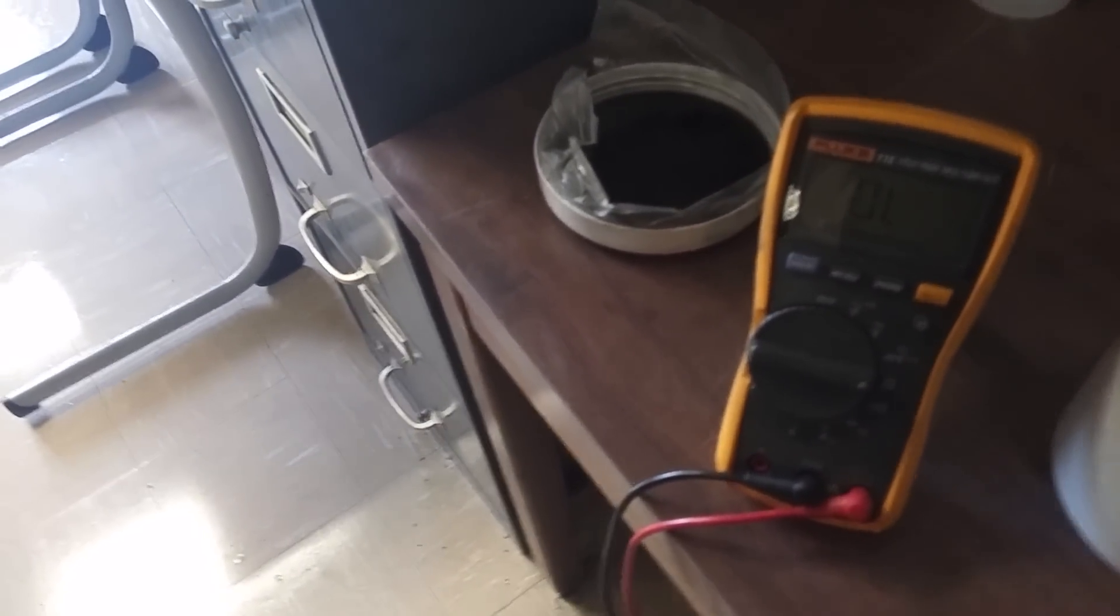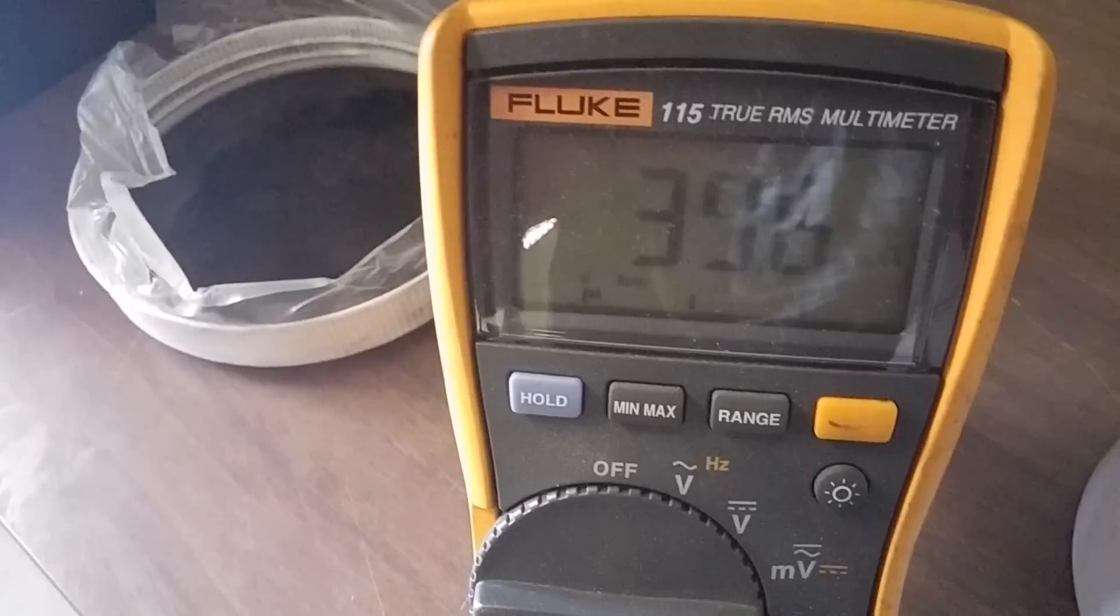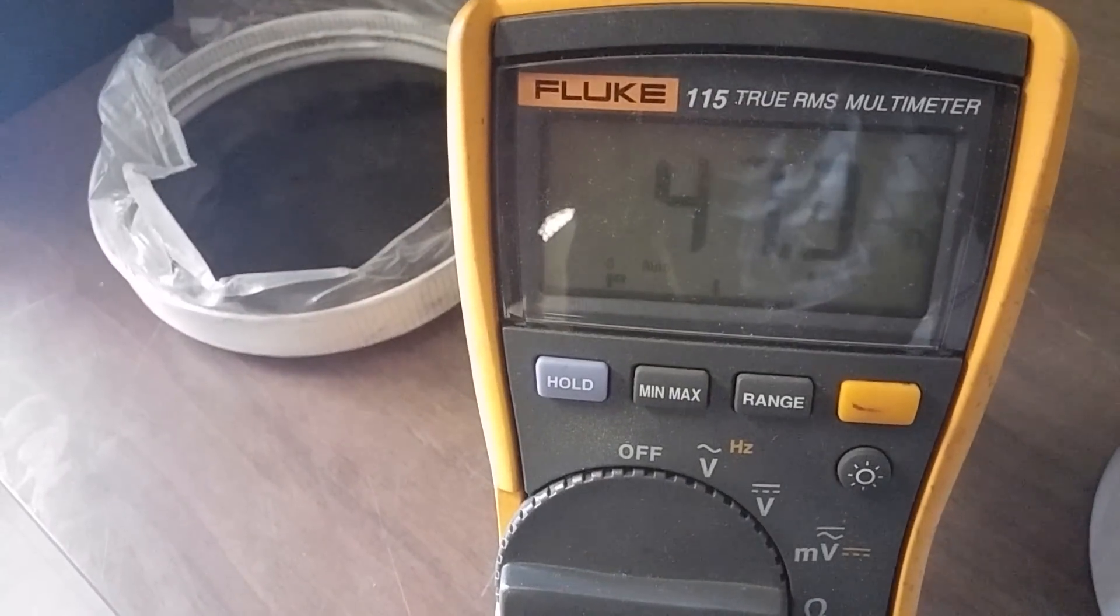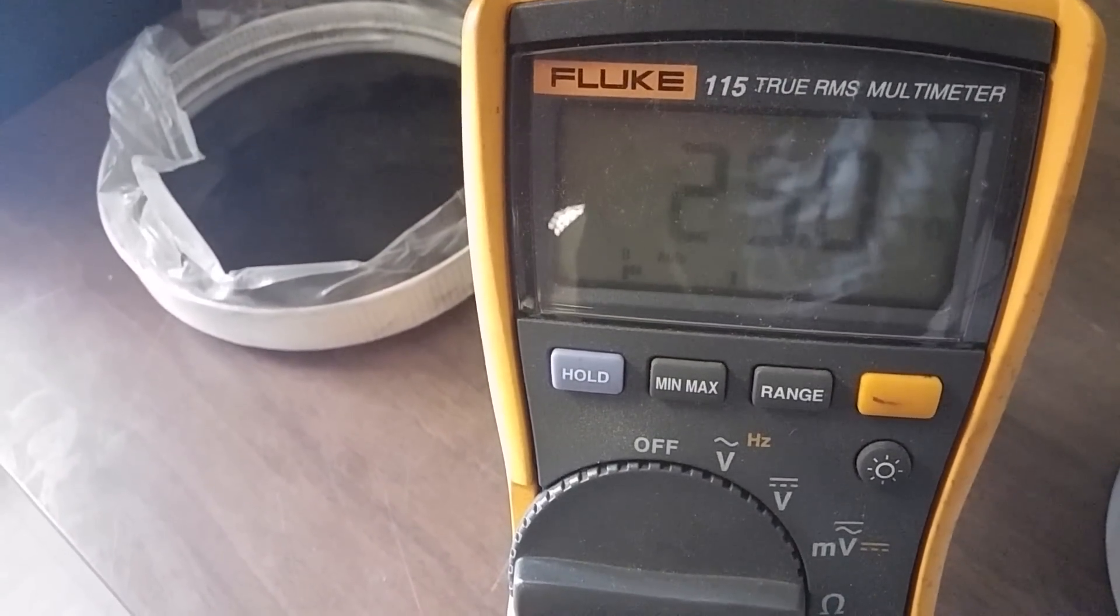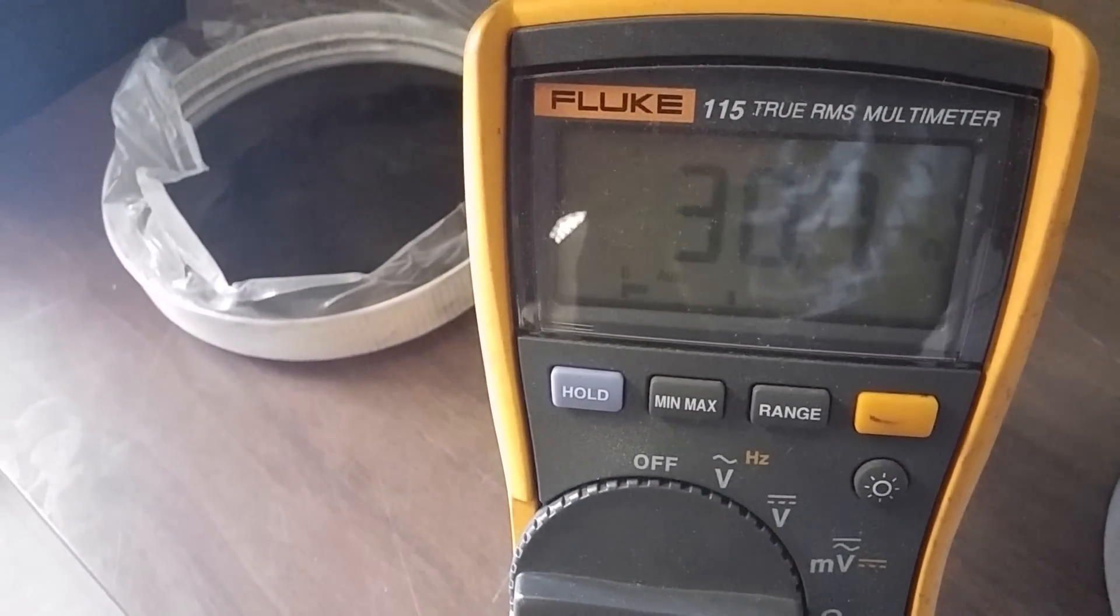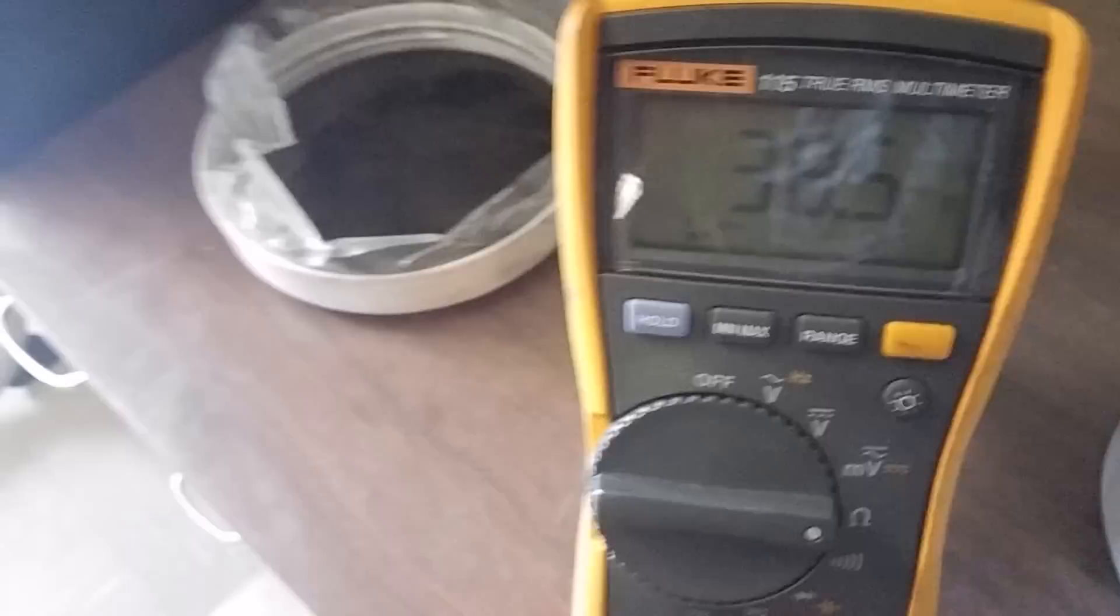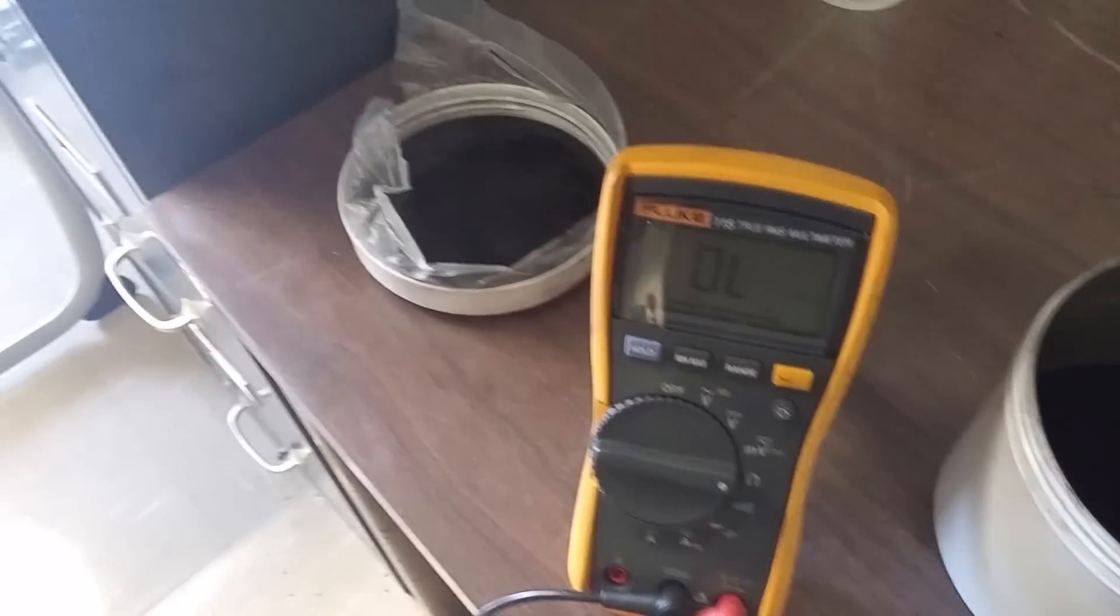Now this is our new stuff from the big machine. It has a little less jump but gets down to around 25 ohms, and that's just a powder.